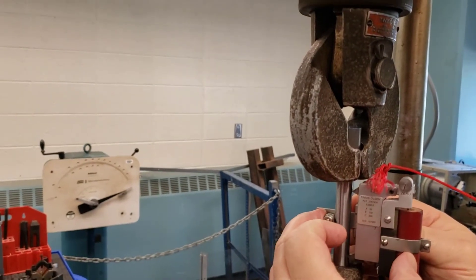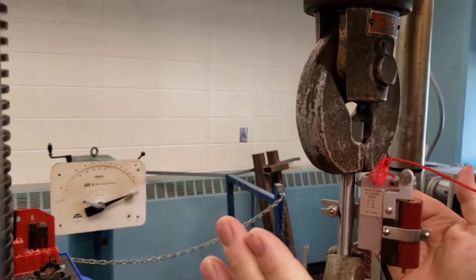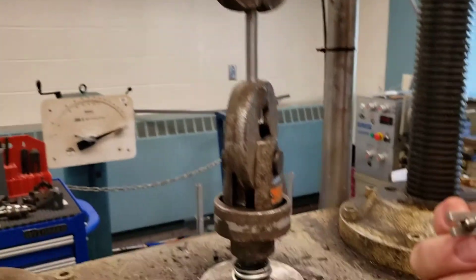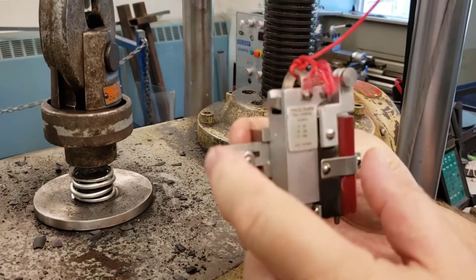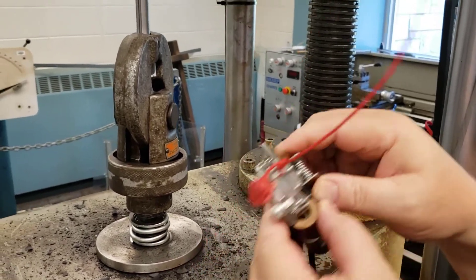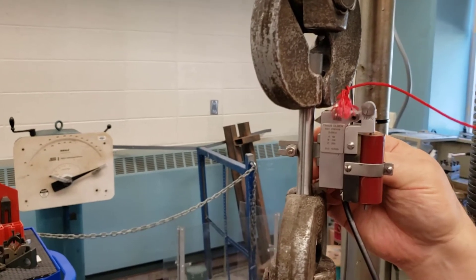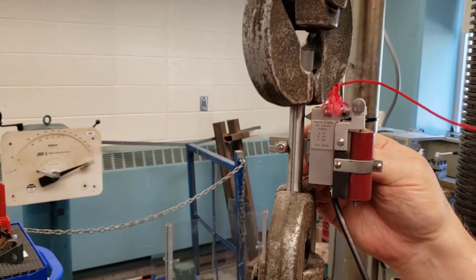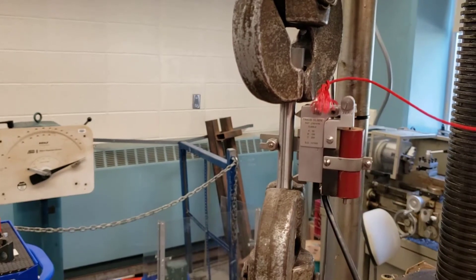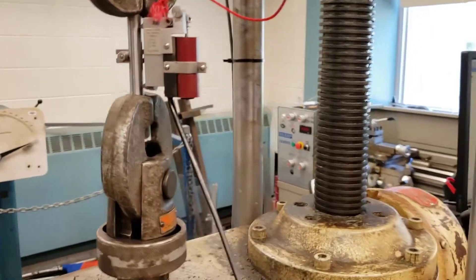We'll get the extensiometer on the roller here and level it up. This arm goes up and down to make our measurement. This is what holds it, and we squeeze it here to mount it. We need to get it nicely in place and mounted. You should not be doing this without your instructor present — this is a very expensive piece of equipment.